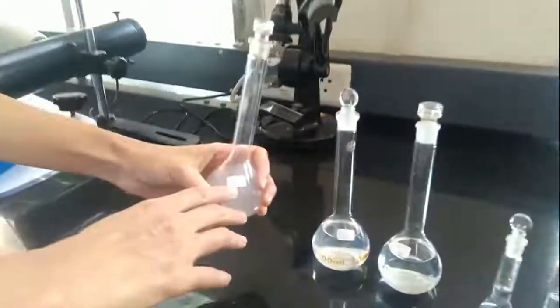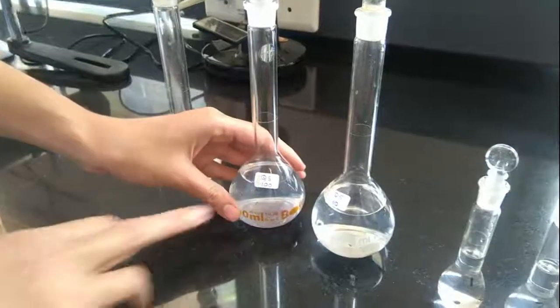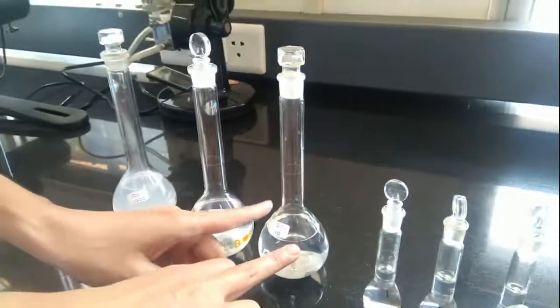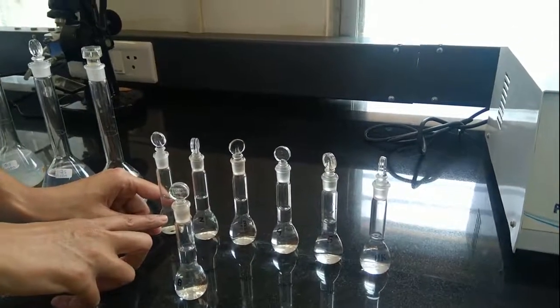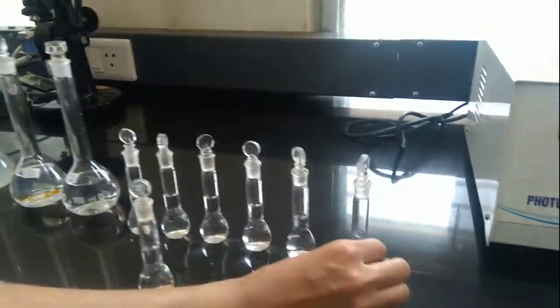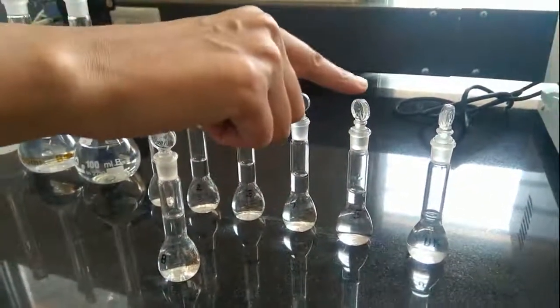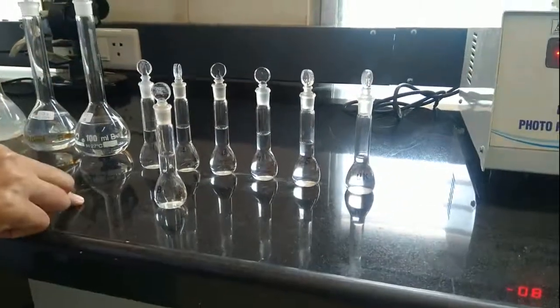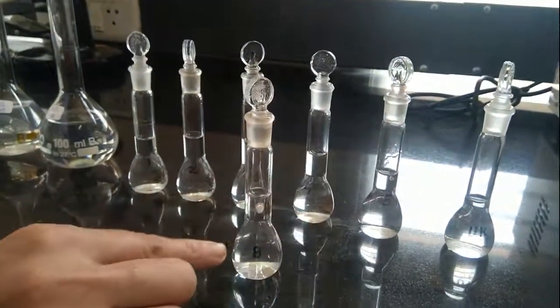Now let us see which samples we have prepared. First, the quinine sulfate standard solution of 1000 micrograms per ml — our stock solution. From that we prepared 100 micrograms per ml, then 10 micrograms per ml of quinine sulfate, and from this we prepared the working dilutions: 0.5 micrograms per ml, 1 microgram per ml, and likewise. This is the unknown concentration — our sample. We will note the fluorescence intensity of all samples, plot a calibration curve of fluorescence intensity versus concentration, and find the concentration of the unknown. The dilutions are prepared in 0.1 normal H2SO4 because quinine sulfate gives fluorescence in H2SO4, so our blank will be 0.1 normal H2SO4.